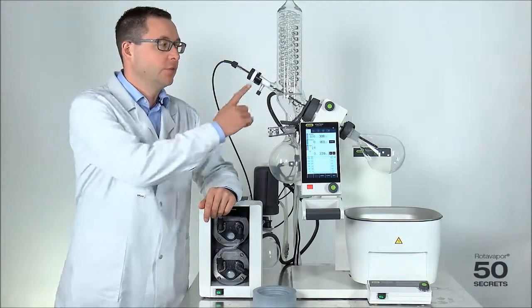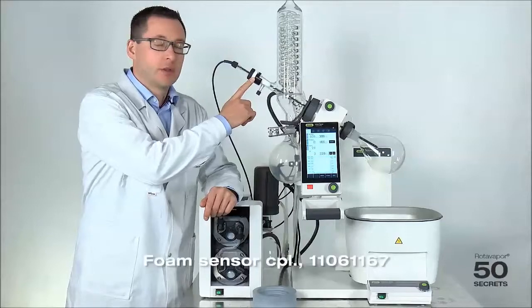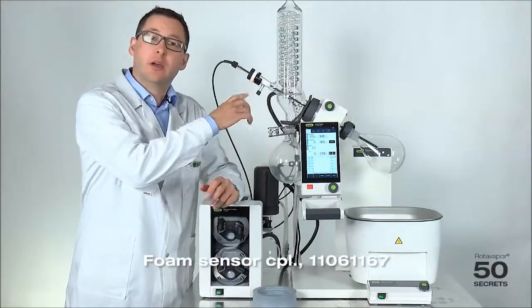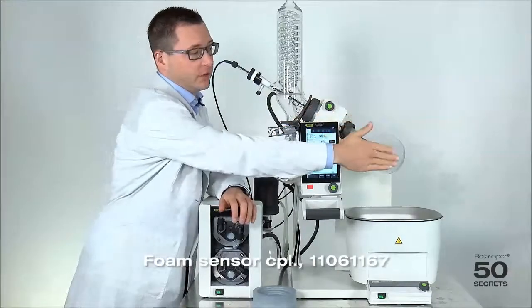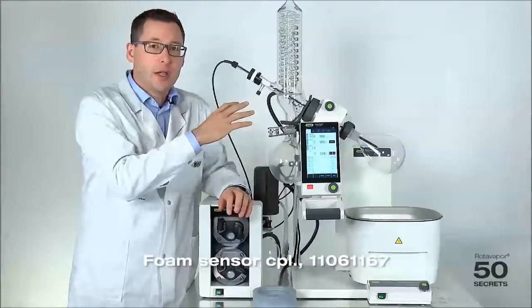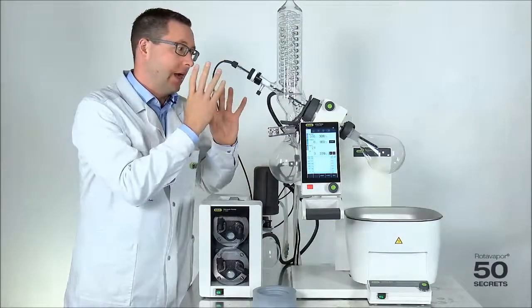Today's secret is about how to mount this foam sensor. The foam sensor is a great product which prevents foam from coming from here into this area. The secret is about how to mount it.